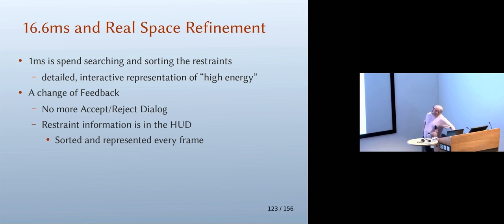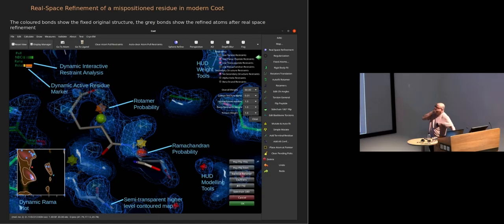So what I wanted to be able to do is to provide feedback in the way that you'd expect from your typical experience of interactive 3D software, let's call it that. So one of the ways we can do that is spend some time in our 16.6 milliseconds to analyze the restraints. And they become interactive, with a representation in colors, using the color scheme to represent energy, or Coot's version of energy. Right, so there's a lot going on here. This is all dynamic and interactive.